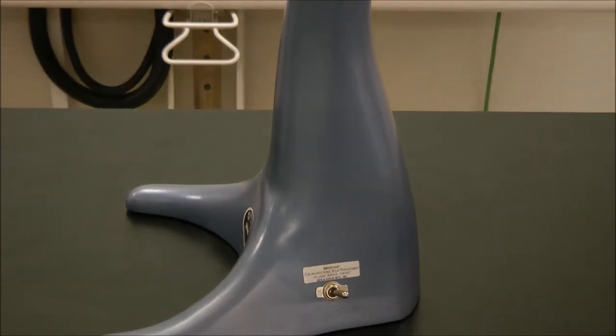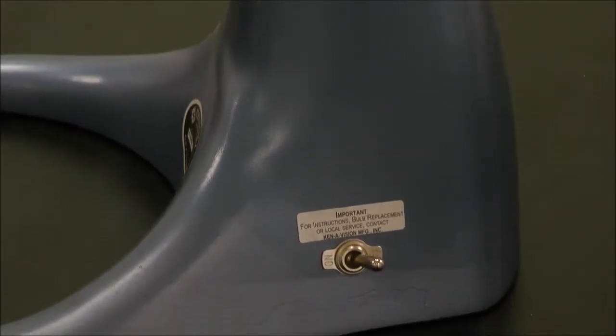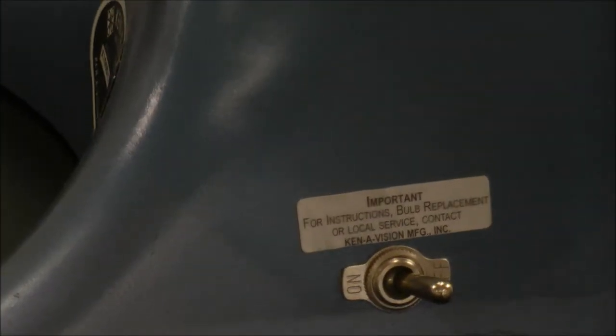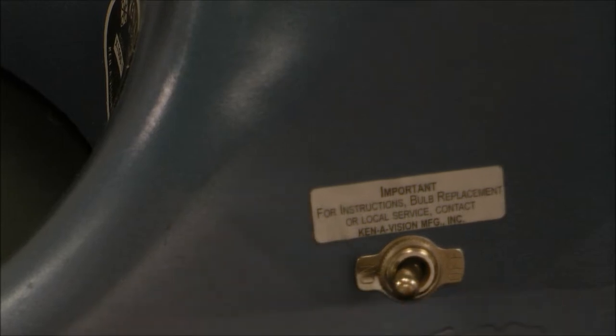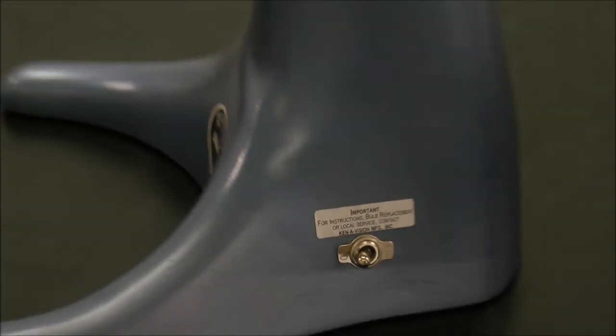To begin, you will need to plug the microprojector into a power outlet. Once you have plugged it in, you may now turn the switch to the on position on the microprojector.